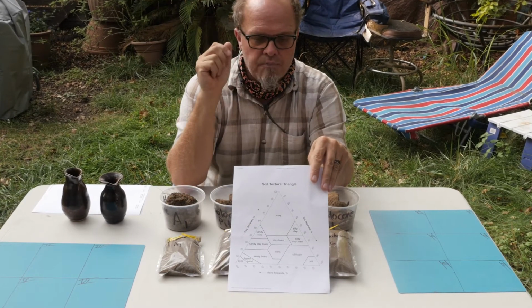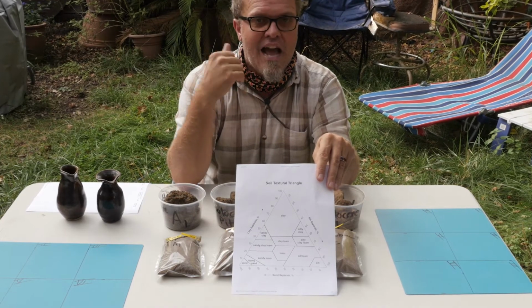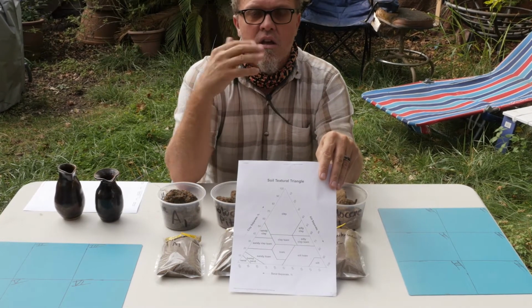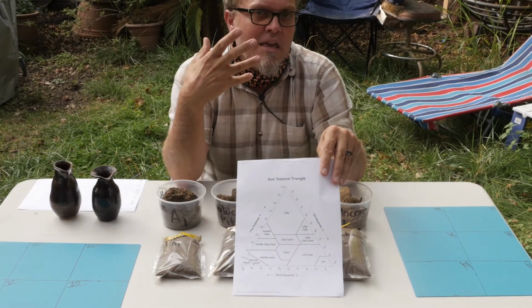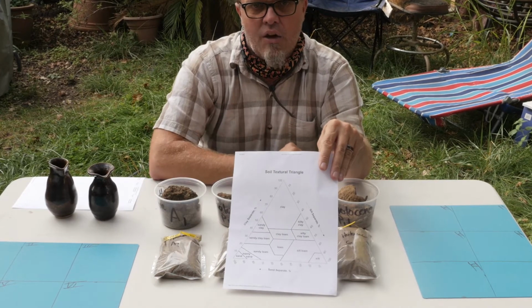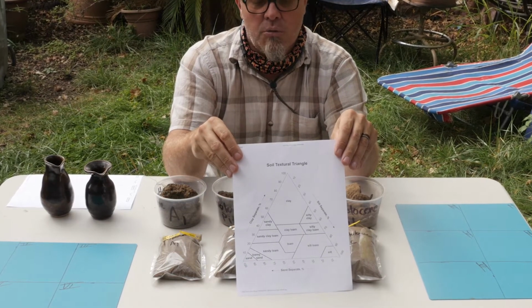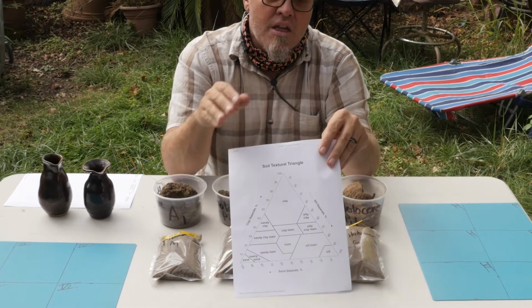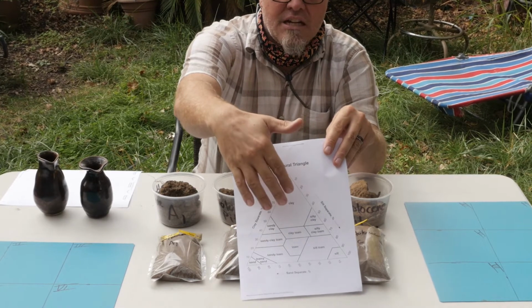We would talk generally, and since part of our goal in the College of Ag is to get you prepared to work in the field, you might hear terms like coarse textured, fine textured, loamy, clayey, things like that, and that's all related to this textural triangle. Like I said, this is pretty iconic, right up there with the color book that we'll talk about in a couple weeks. So we're going to use our hand and try to calibrate it related to this triangle.